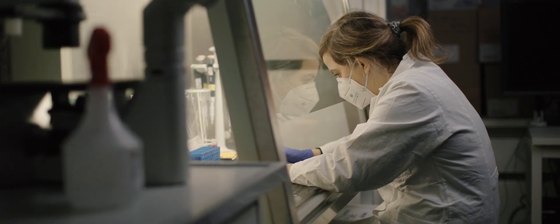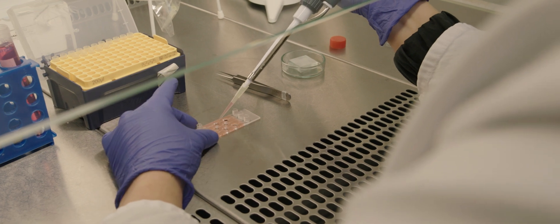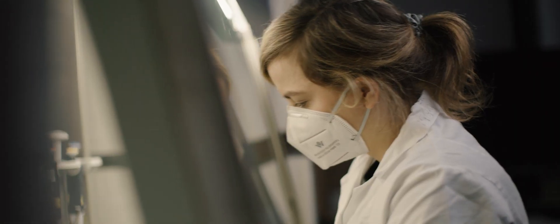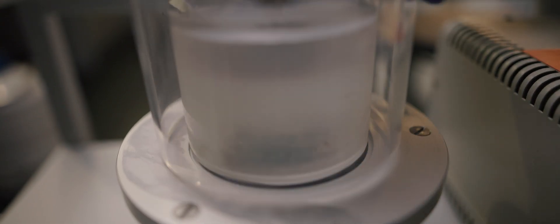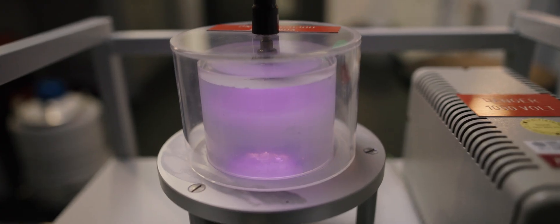Cryo-EM actually starts with the preparation of the sample. The sample can be a protein solution, whole cells, lysed cells, or just some organelles extracted from cells. We use different types of EM grids with different supports depending on the application or the biocompatibility. Glow-discharging allows the EM grids to better retain aqueous samples, whereby an electric current changes the grid surface to become hydrophilic and charged.